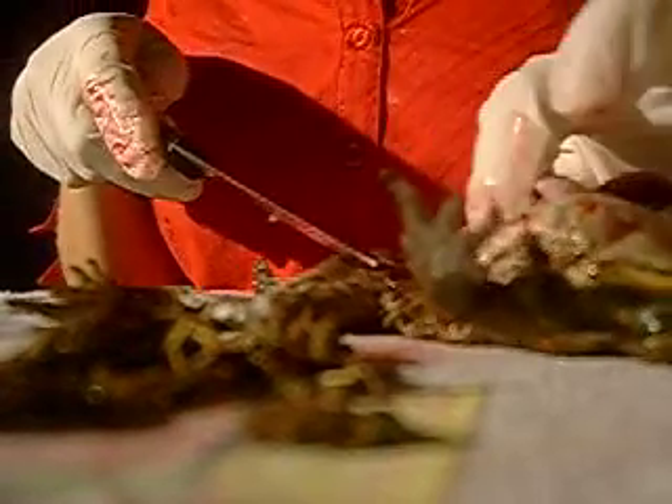You're pulling out the food organs. What is this food organ? Does it digest it? Three of the food organs? You've got to remove everything from the body.